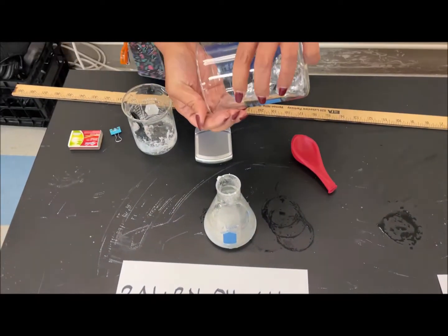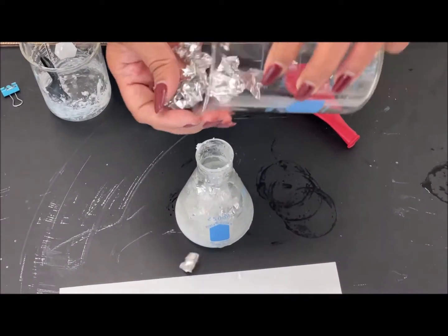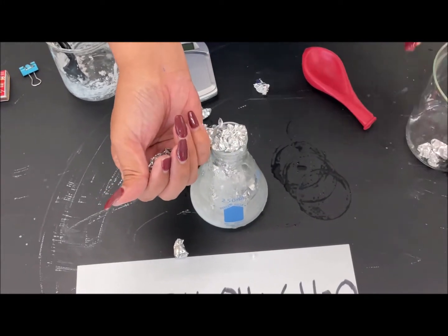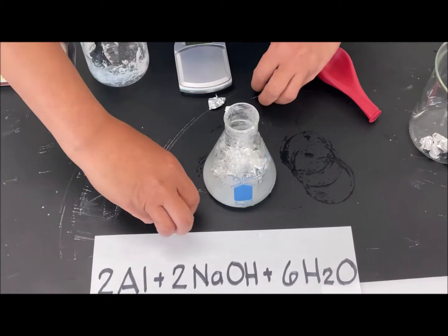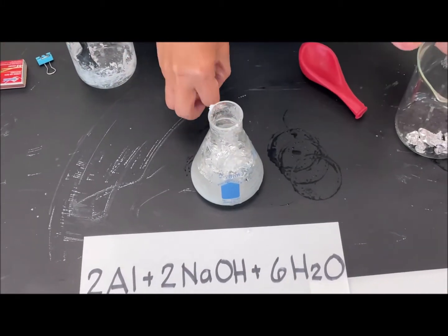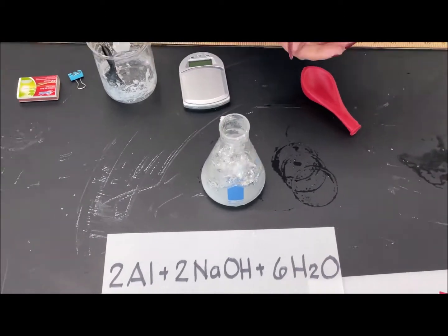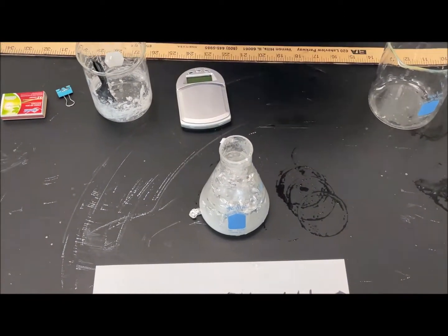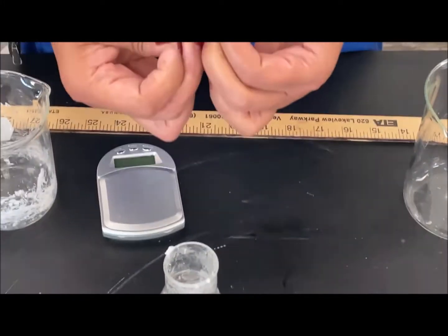And then we will put in our aluminum foil. It's good enough. Just put them all. And we're going to enclose it with a balloon.